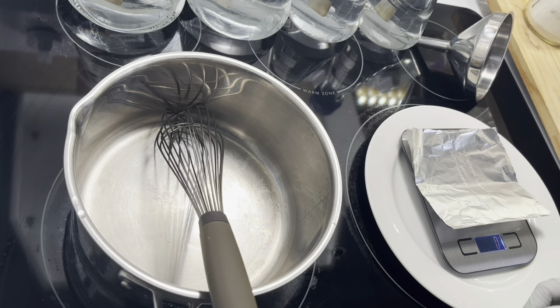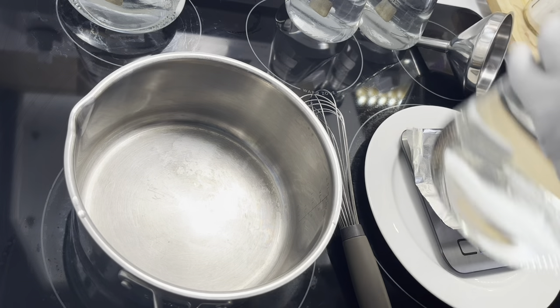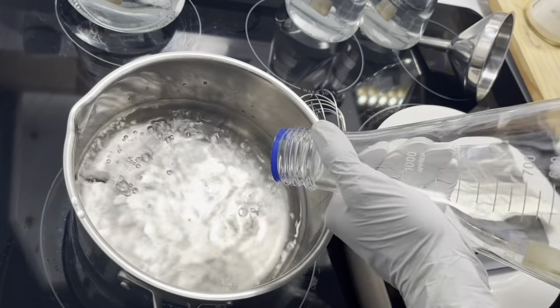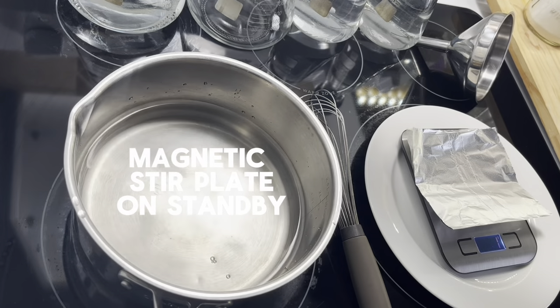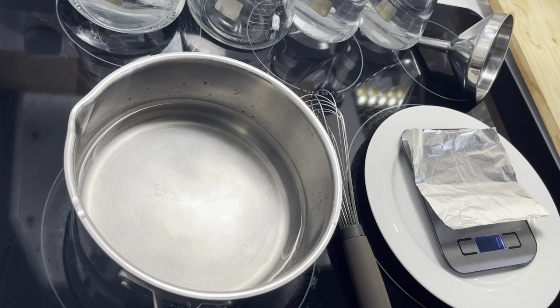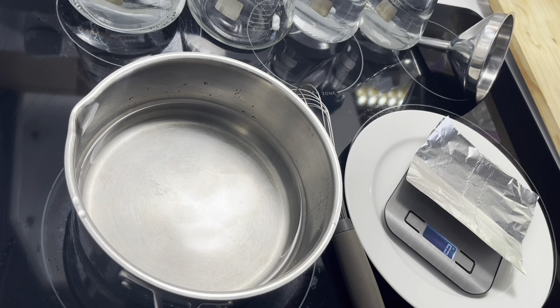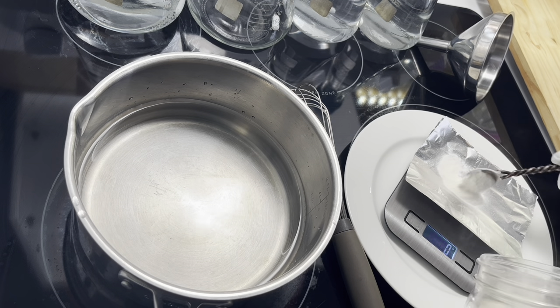I'm going to make water agar and nutritional agar. First I'll make the water agar. I already have a bunch of water agar trays so I'm just doing one jar. You want it to stir as it cools — if it does not stir while it cools it will solidify. I wait to pour until it's 113 degrees. I tare the scale and for 1000 milliliters I use 18 grams of agar.